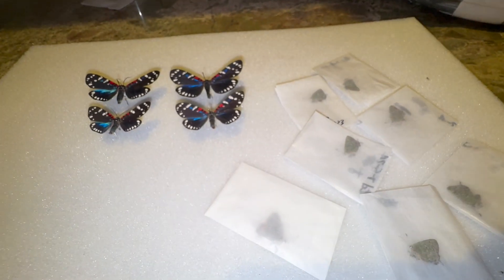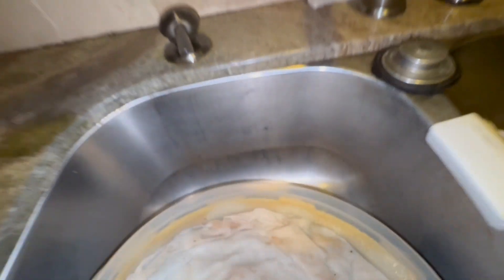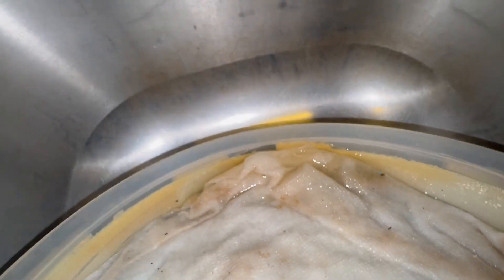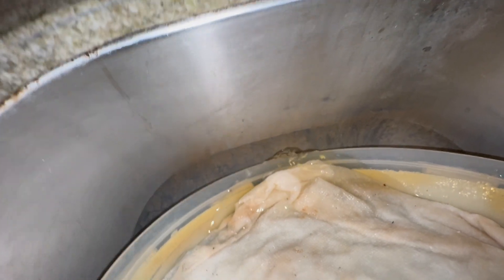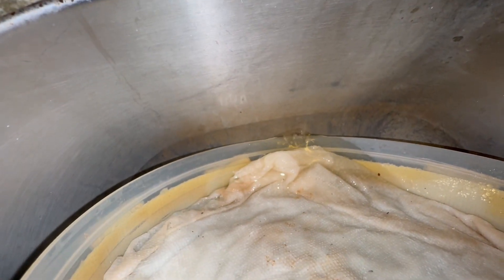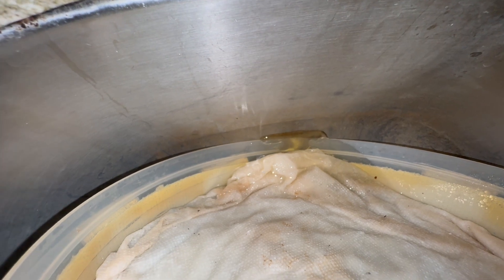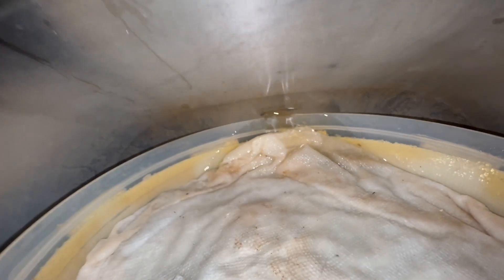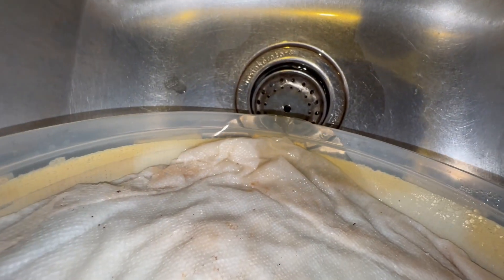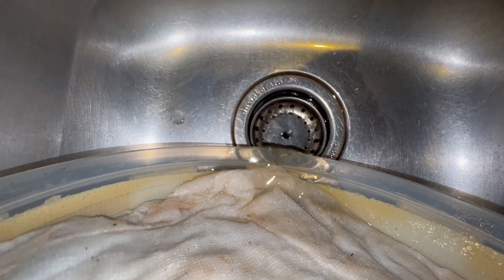I'm impatient, and I know you guys probably are too, so I don't have time to play around. What I'm going to do is actually dump the water that's been in this container for a couple of months, because it smells like chlorocresol.